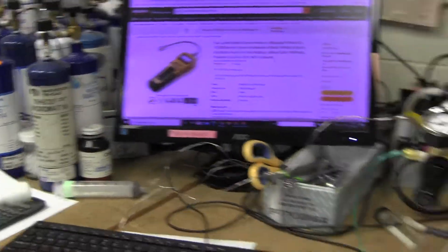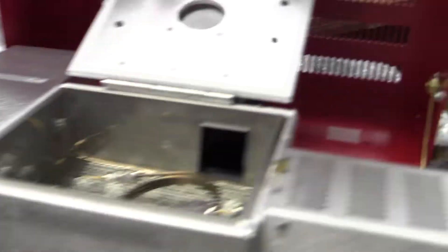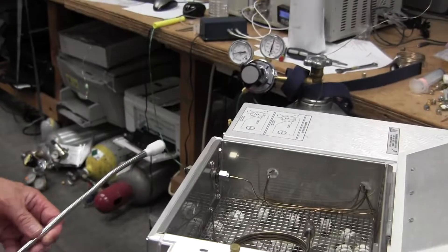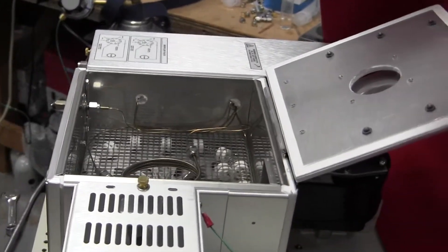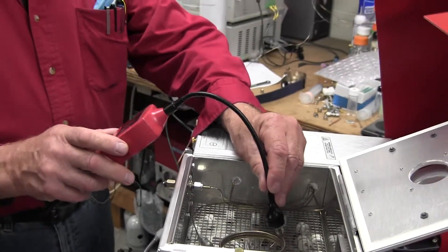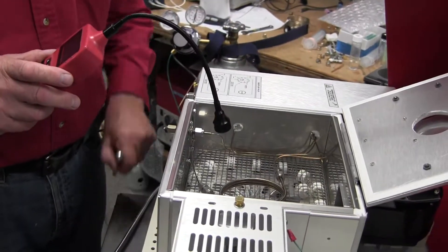If it's $25 or $100, it's somewhere in that price range, so it's not prohibitive to get it to work. You pressurize the system with hydrogen, and then you sniff each fitting in the GC to see if you can detect a hydrogen leak.